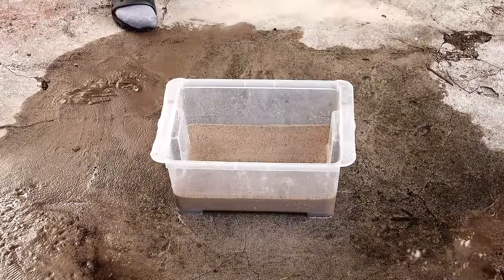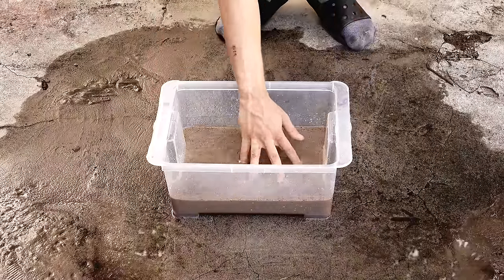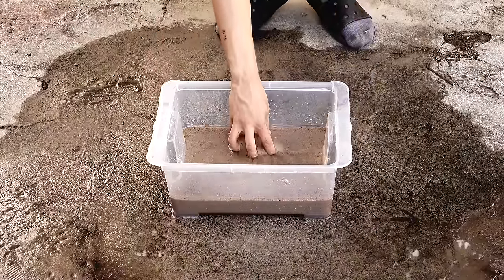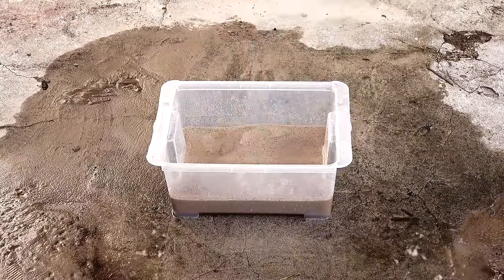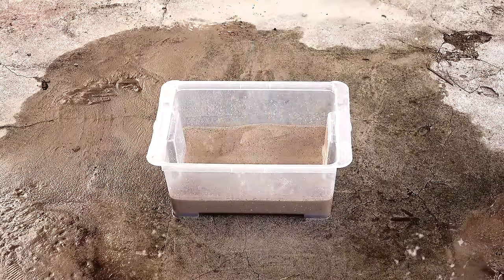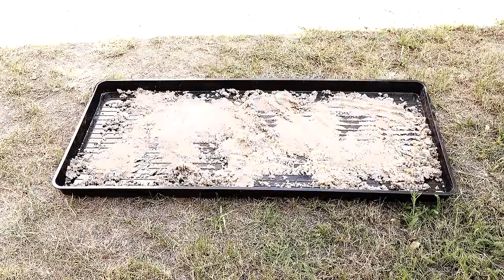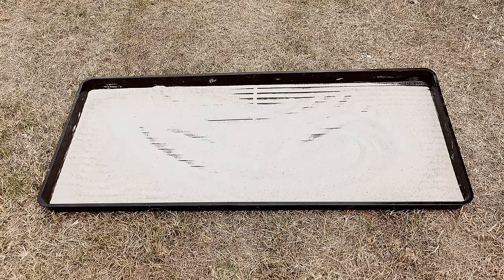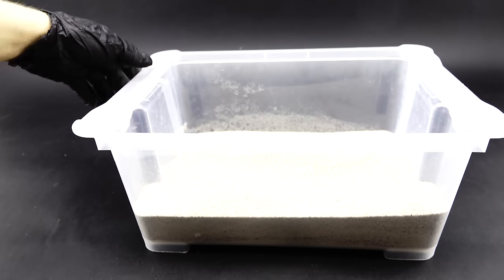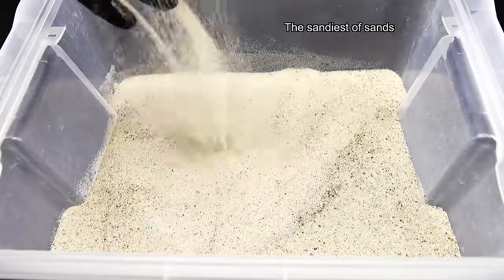The sand was now a little whiter and felt more runny for some reason. I had to wash it one more time, and before doing that, I neutralized all the leftover acid with some baking soda to make the future flood more eco-friendly. I then got everything outside and again washed the sand with an ungodly amount of water. When I was done, the sand looked much better than before and nothing like starting dirt. It should now be composed of nearly pure silicon dioxide, and now it's time to finally move on from playing with dirt to doing some actual chemistry with this extra pure scientific sand.